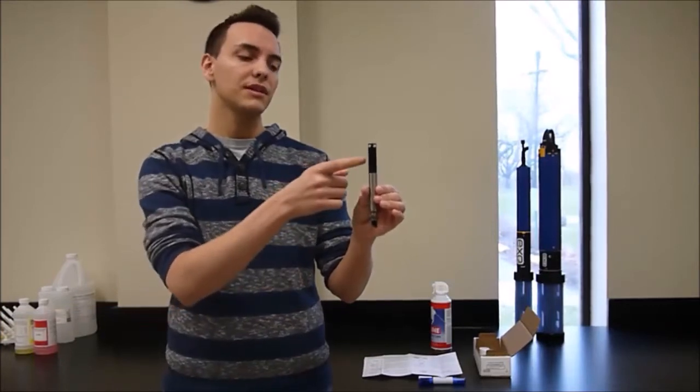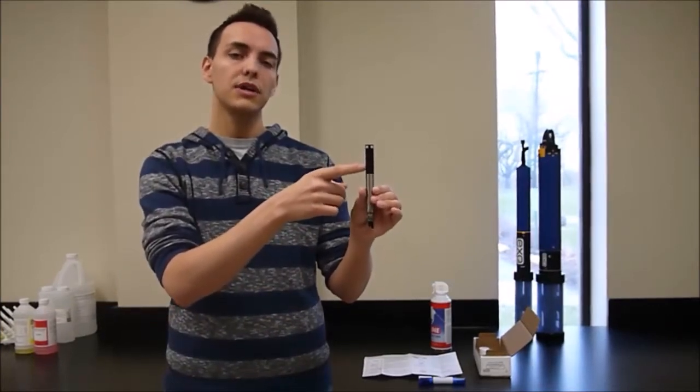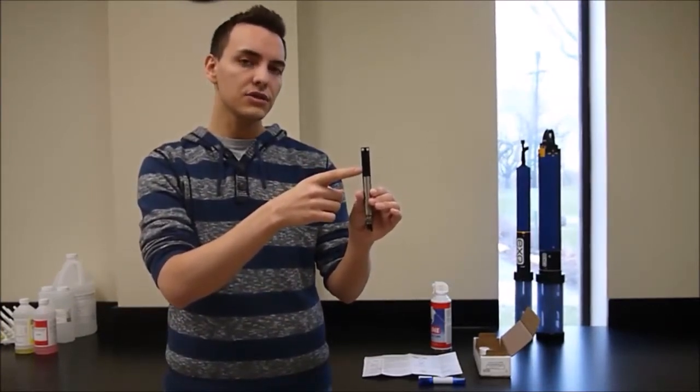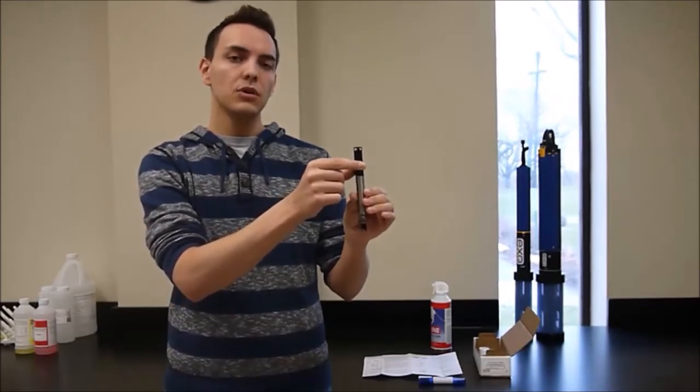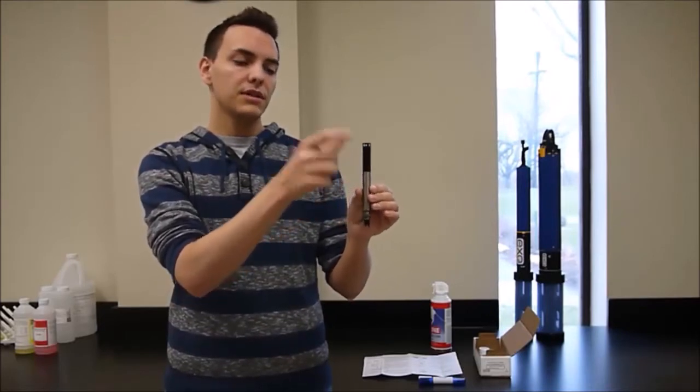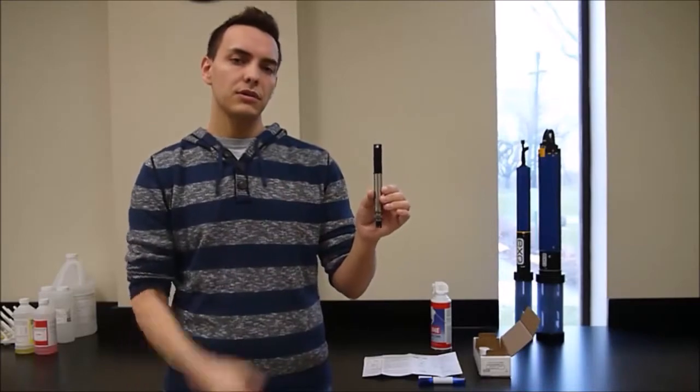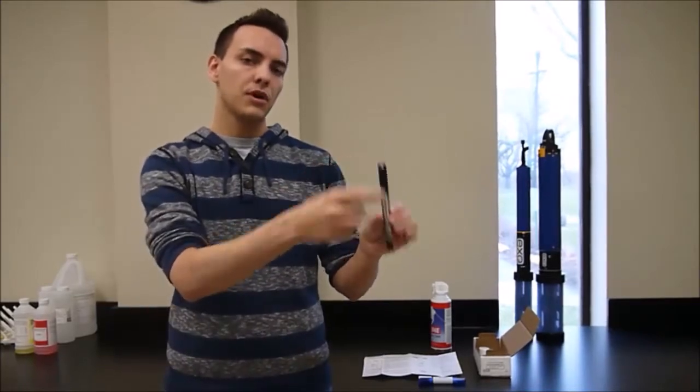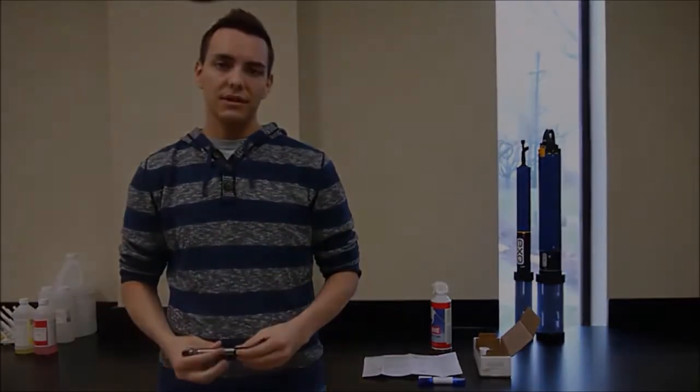One of the unique features of the Exo platform is that our pH sensor comes with a replaceable tip. All the chemical reagents used in the sensing technology are housed here, so when you run out, instead of replacing the entire pH sensor, you just replace the module. This video is going to cover that process.